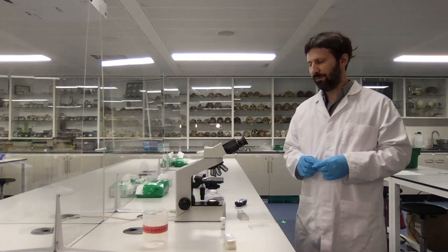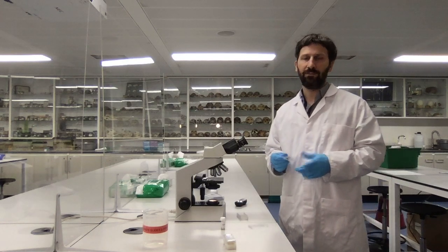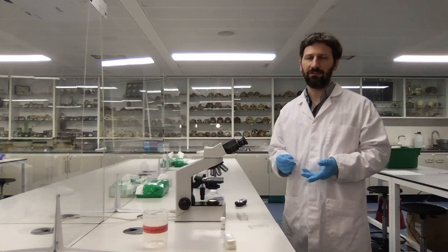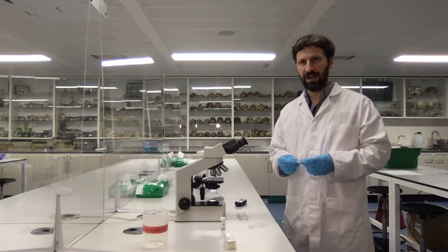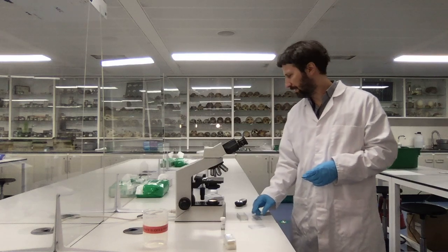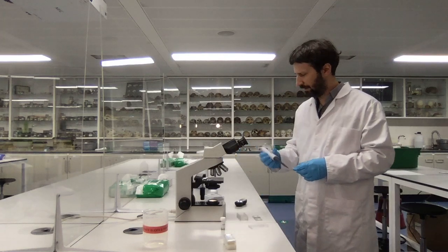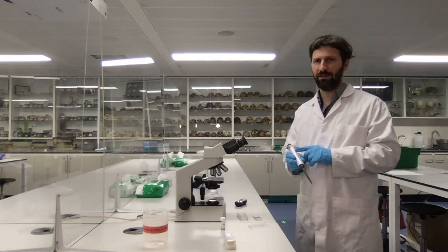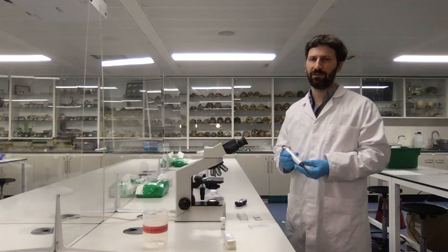In order to use the hemocytometer — today I have one model, and there are different types — this is an improved Neubauer model. We need to put a sample on this special microscope slide, and to do this we use a micropipette. I take the pipette that goes from 0.5 to 10 microliters because I need to take 10 microliters of suspension.